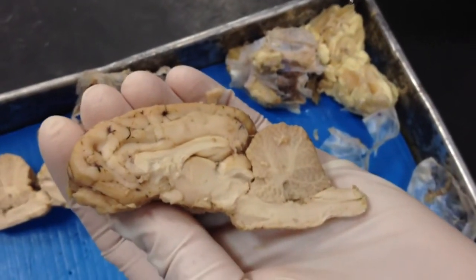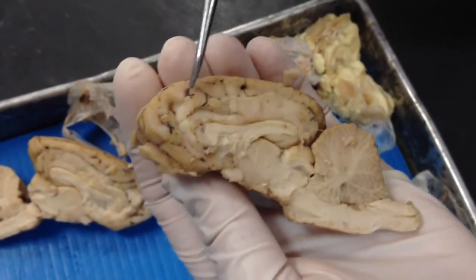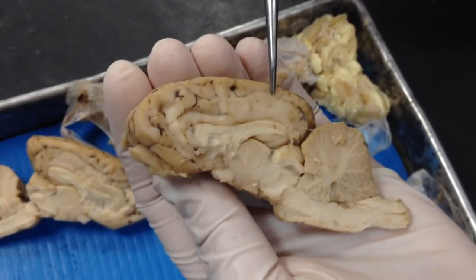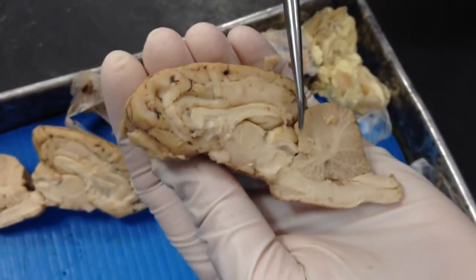The cerebral cortex. And the cerebellar cortex.